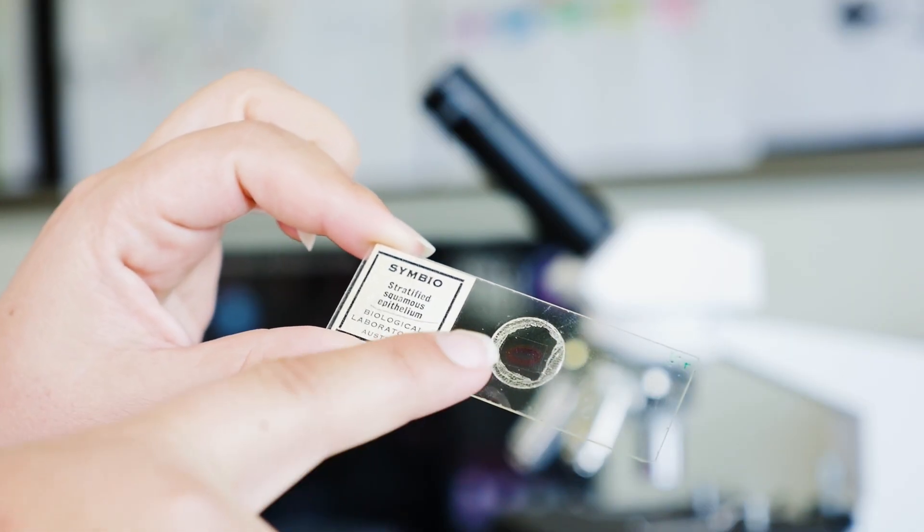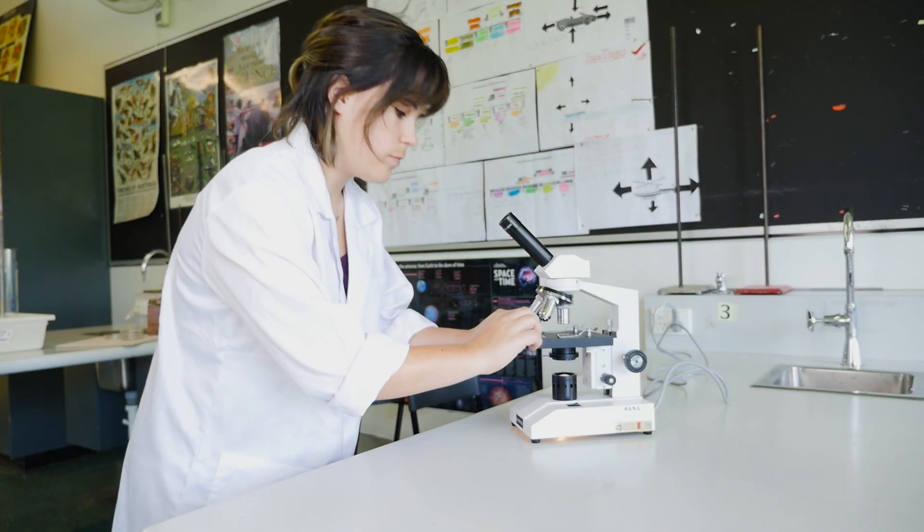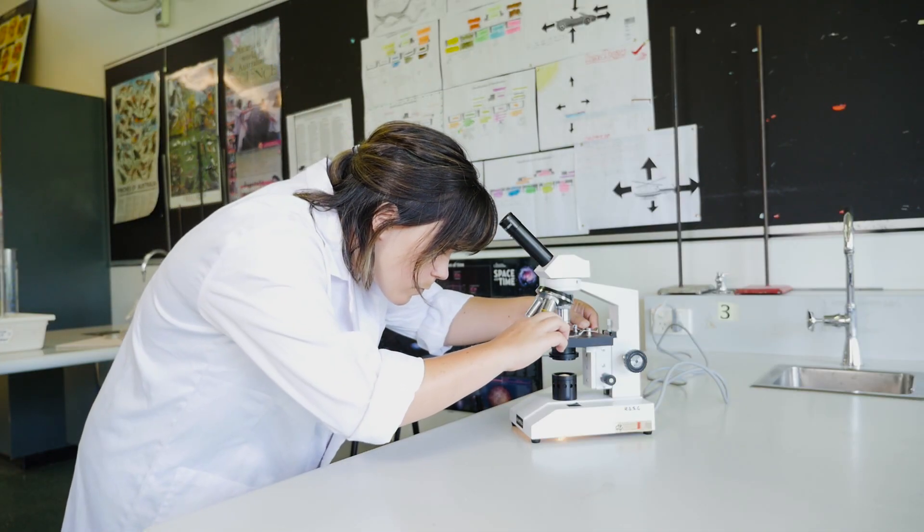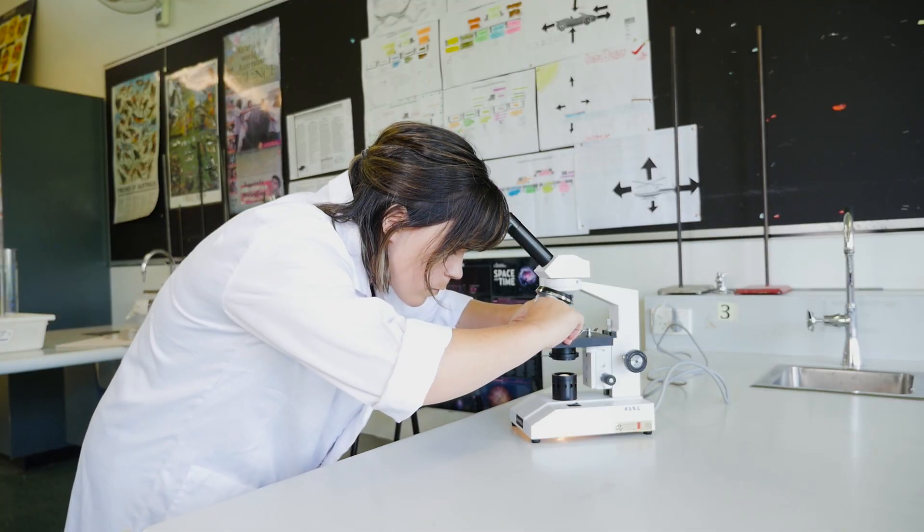Here's a slide. Take a close look at it and find the specimen. Put the slide on the stage so the specimen is right in the center of the hole in the stage where the light comes through. Then clamp the slide in place.